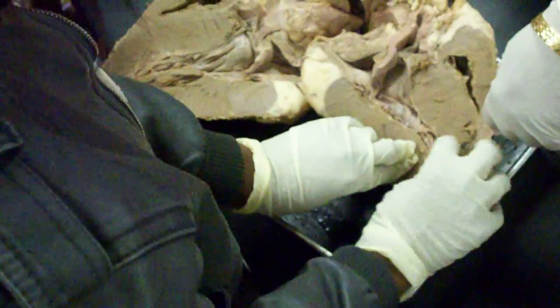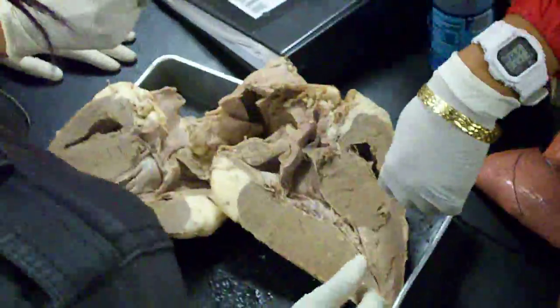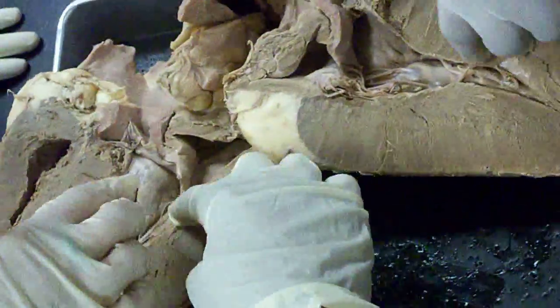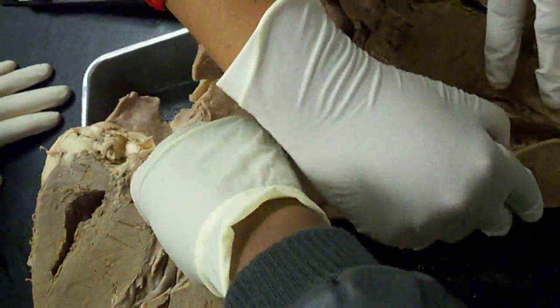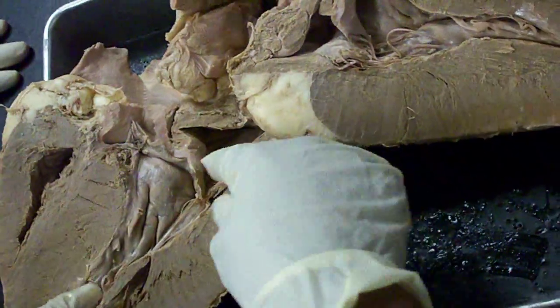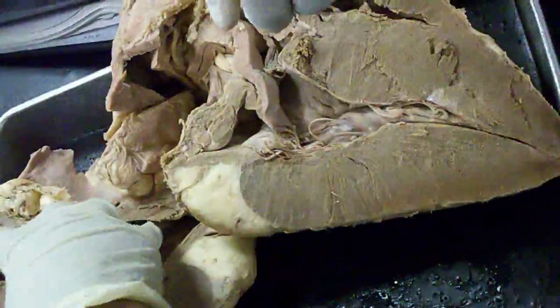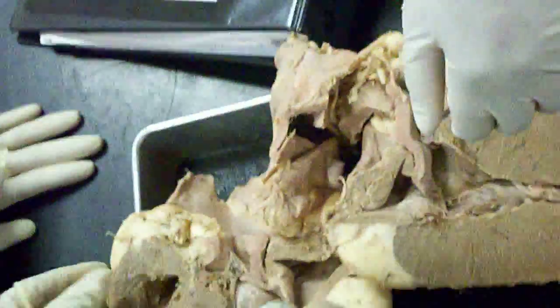And then the one after is that word — the chordae. This is the chordae. And that's the AV now — it was on the left side. It's bicuspid. And you can do it to the right side too.